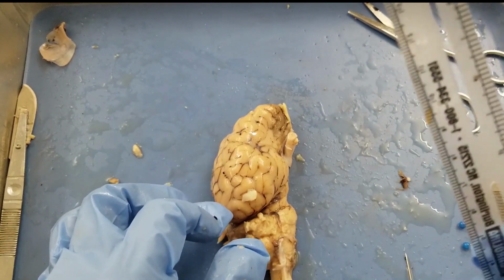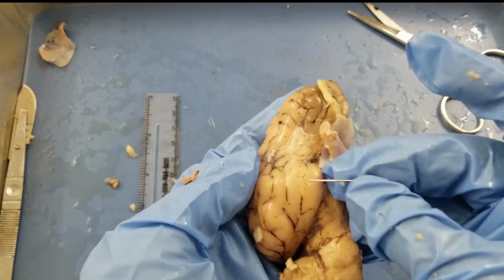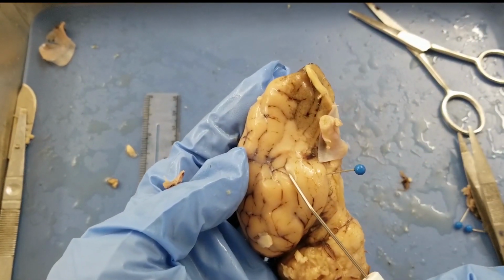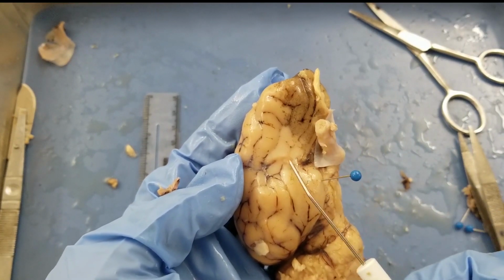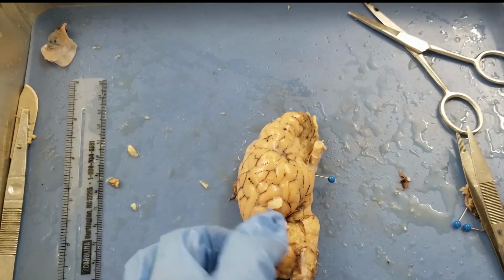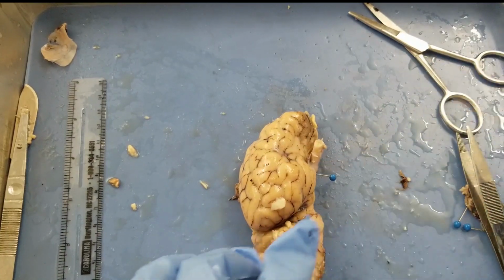And then we need to locate the periamygdaloid cortex. If you remember, this is the periamygdaloid cortex here, right? And if you still remember, we have a sulcus, that's the rhinal sulcus. That's where the olfactory bulb and olfactory tract go to the rhinal sulcus. That's your smell information source here, okay? And next one, we need to cut everything anterior to this periamygdaloid cortex away.